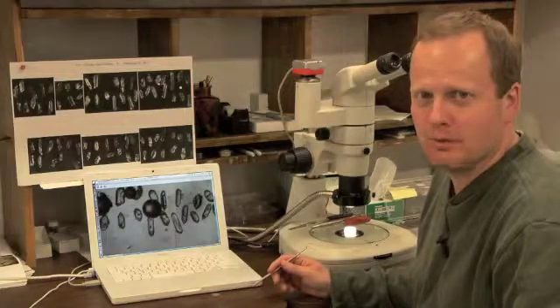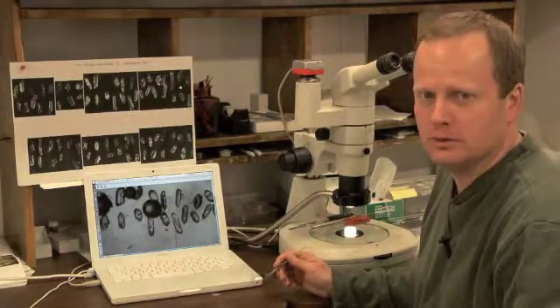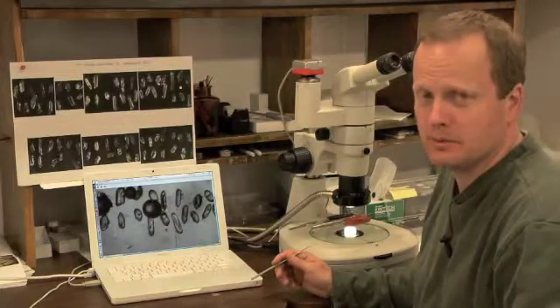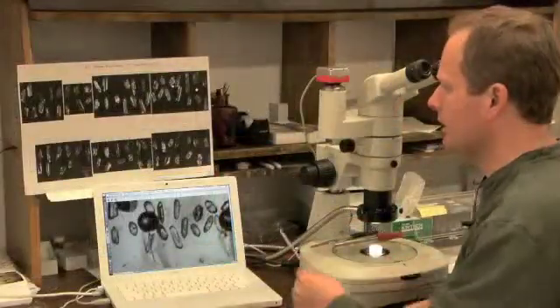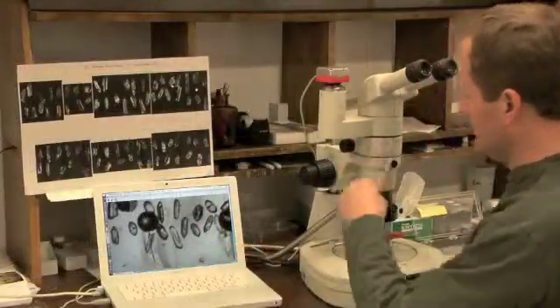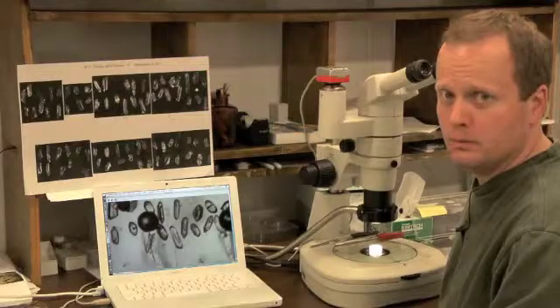Today I'm preparing some zircons for chemical abrasion prior to isotope dilution thermal ionization mass spectrometry. I have an optical image here that I'm taking live down the microscope.